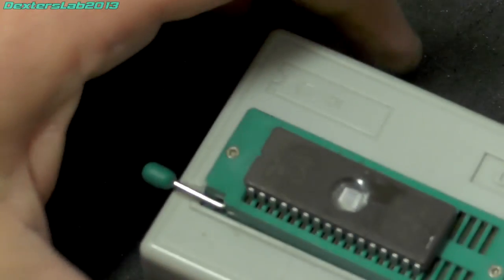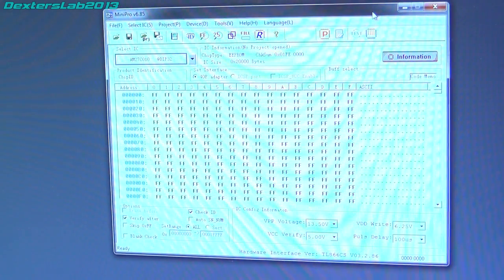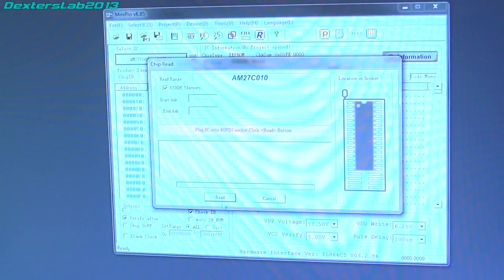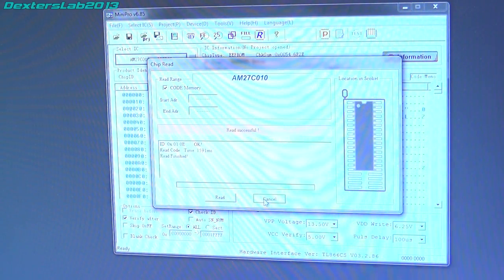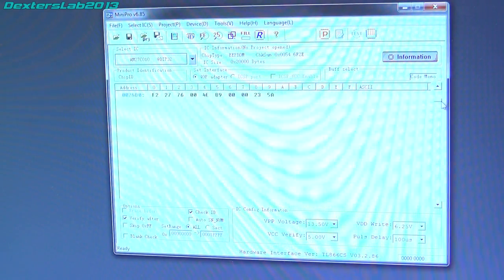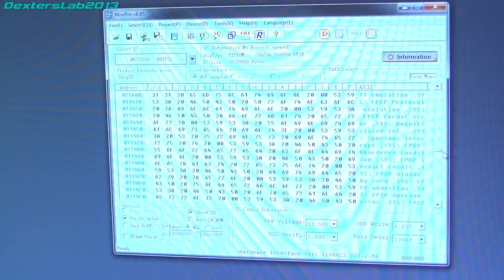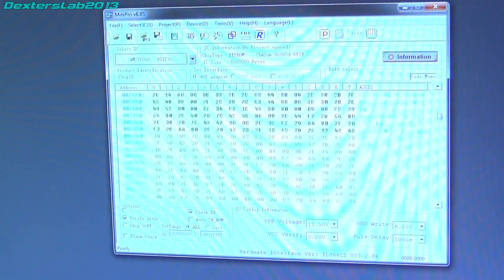It is a 27C010. Right. See what we can find. It's a bit of readable text in there.